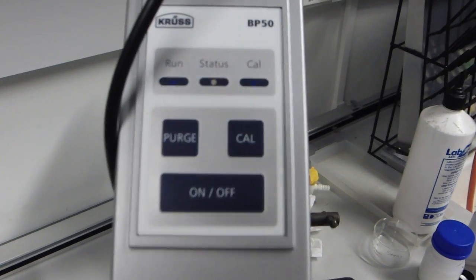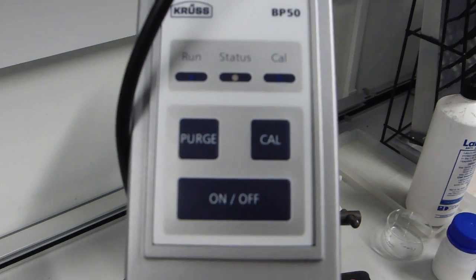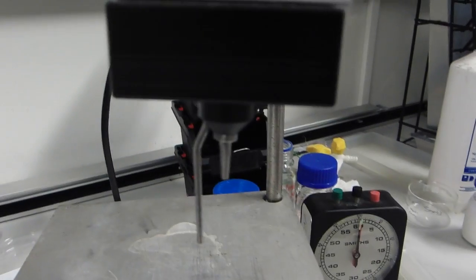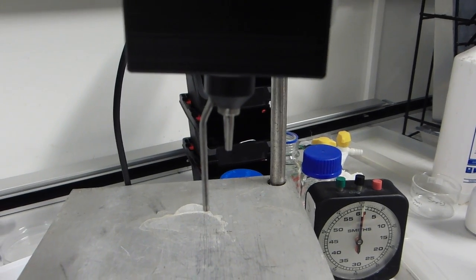The unit itself has buttons for purging the air supply and calibrating. Below this, these probes together act as a capillary, pressure sensor, and temperature sensor.